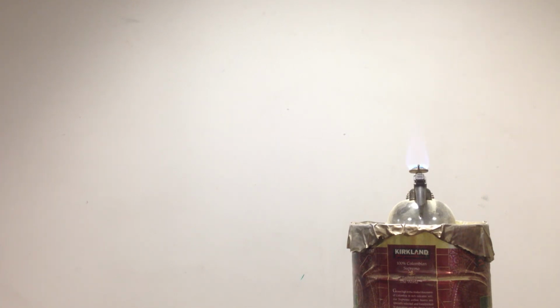Here we go. Okay, that was pretty lame. One more time. Okay, just putting some more in. Here we go. And that is the dragon's breath demonstration, surface area demonstration.